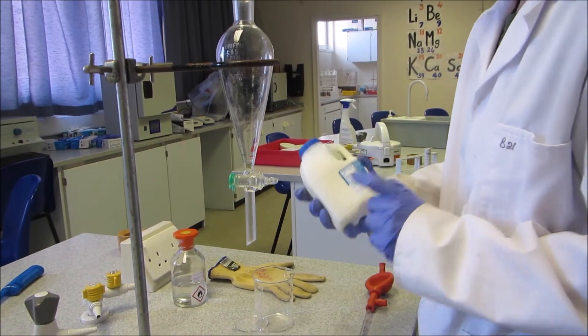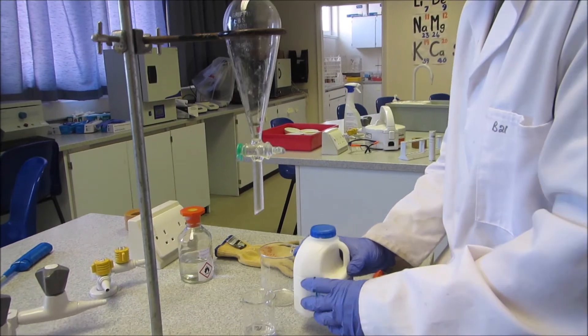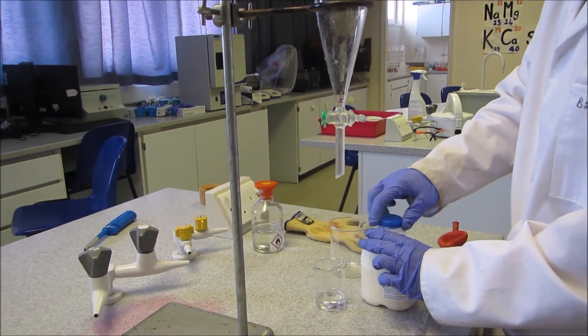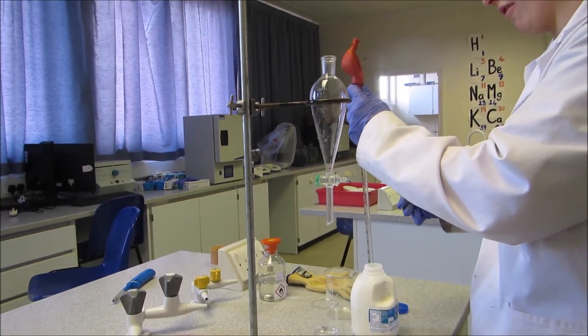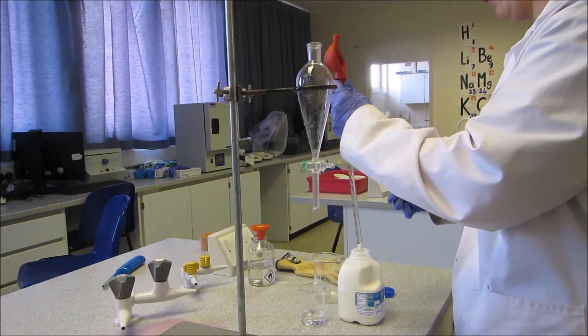To estimate the fat content of milk, I've got full fat milk and I'm going to pipette 7ml out of this. It's a good idea to use a beaker, but as this won't be drunk, there's no risk of contamination.